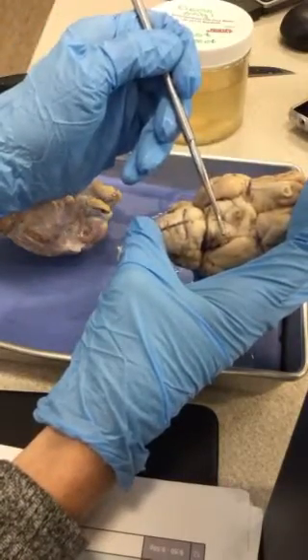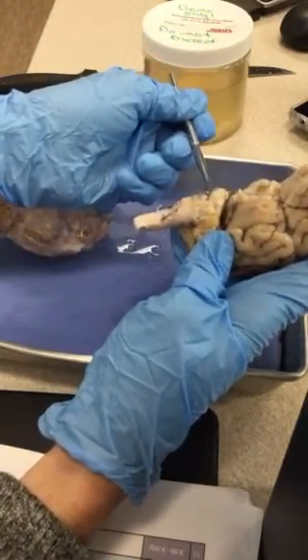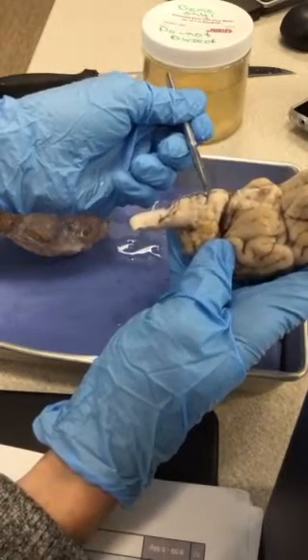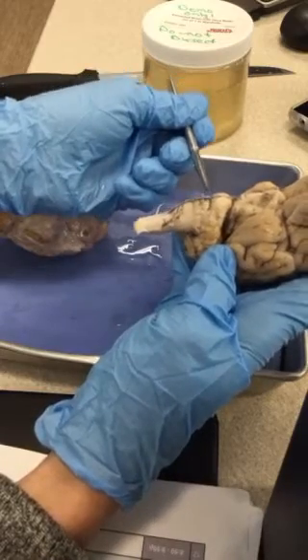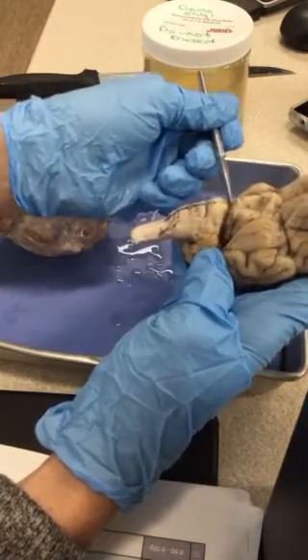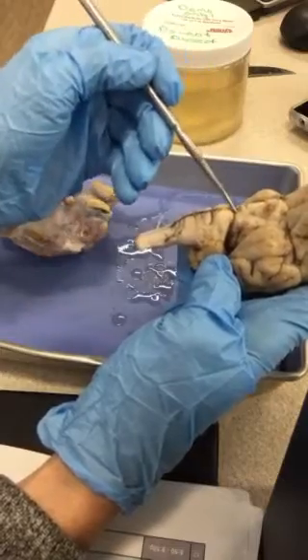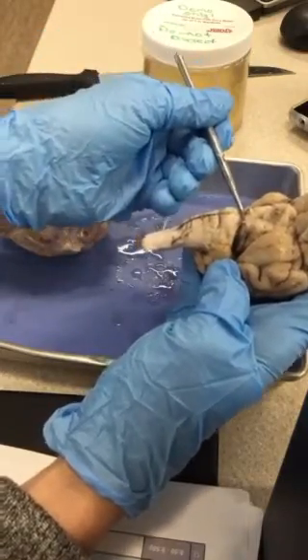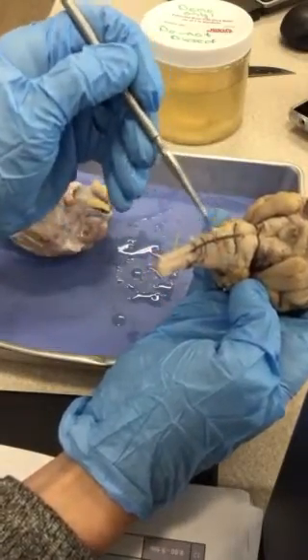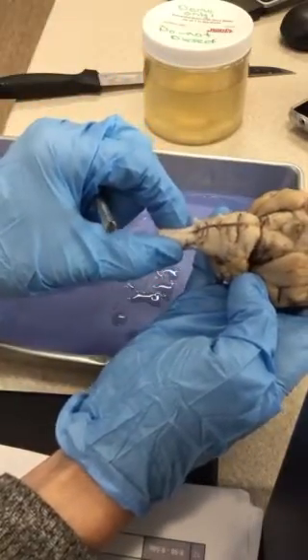So that's the midbrain. And then here, if I look at a side view, remember I said the pons is a lot shorter in the sheep brain than it is in the human brain, but there's still that swelling there. So that's your reference point for finding the midbrain. Because I remember when I took anatomy for the first time, I struggled with that midbrain. So find the pons, which is the swelling, and then just above that is the midbrain, and it's the V-shaped structure here of the cerebral peduncles. So then we have the pons, and then this whole structure here is the medulla oblongata. So it's oblong. And then where it narrows again is that spinal cord.